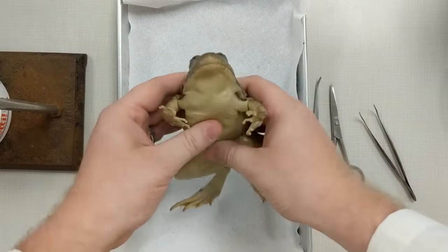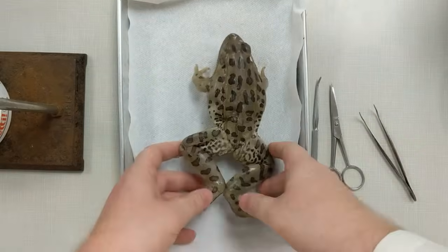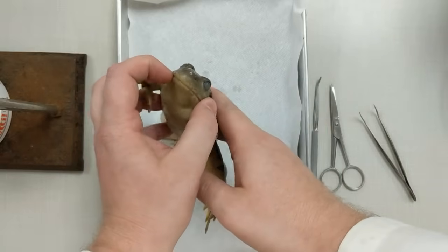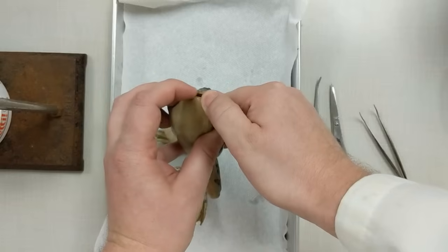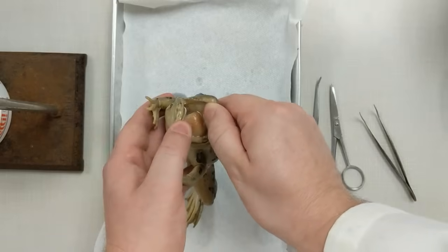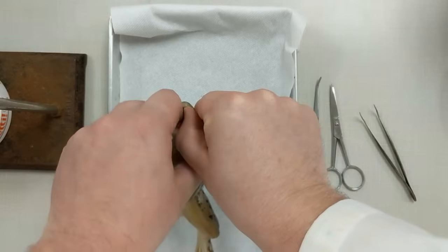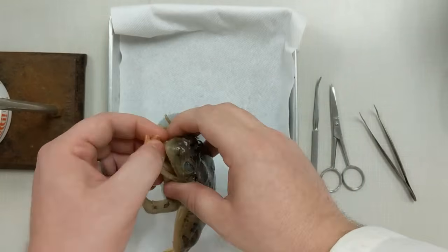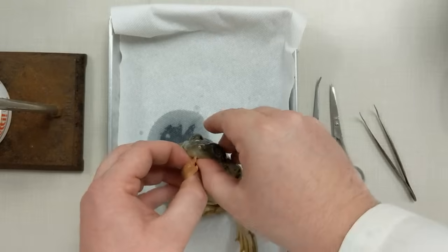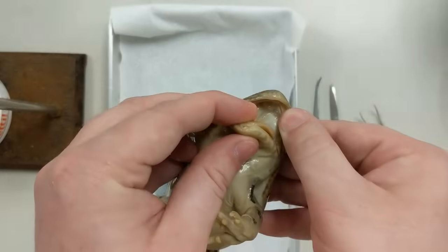This is our video walkthrough of our frog dissection. The first thing is that you're going to get your frog and take a look in its mouth. How you're going to get the mouth open is that you're going to have to pry it open a little bit — it'll be hard at first. In order to see the tongue, you can pull it out to see how it attaches, which is a little weird and different from our tongue, since they use it to catch their prey.